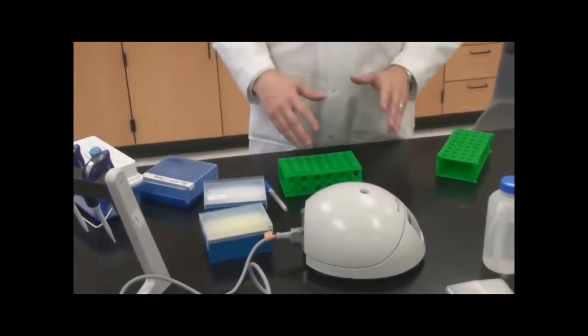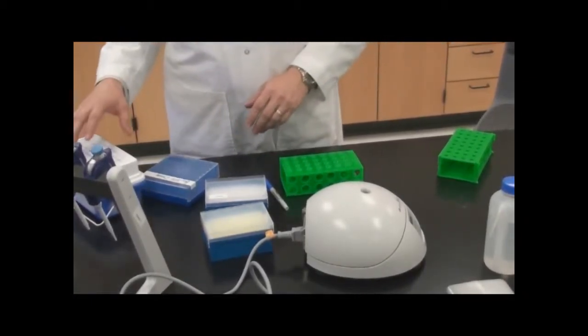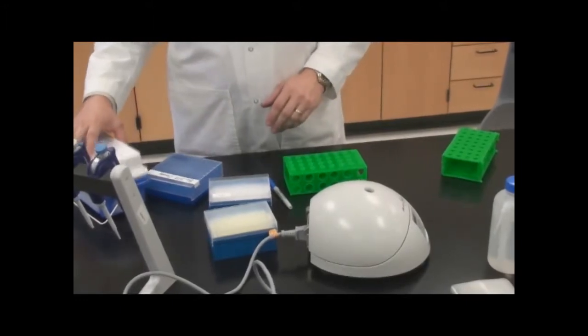Okay, so now we've finished the cleaning step and we're going to move directly into our ligation. And to do our ligation, there's a couple things that we're going to need to do.